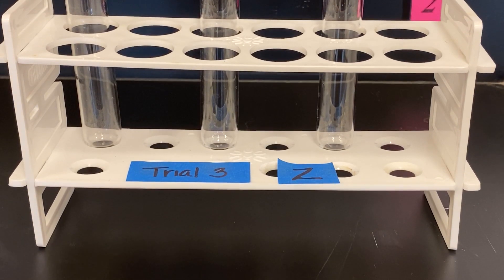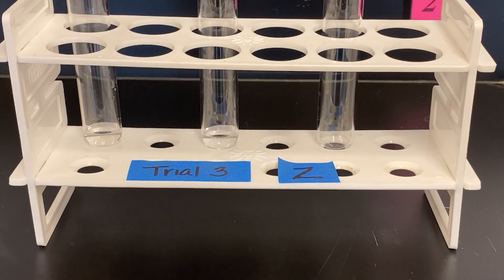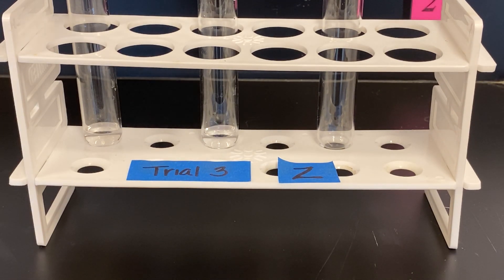So we are going to add Z, unknown solution Z, to each test tube. Each test tube again is being filled with one ml of the unknown solution.